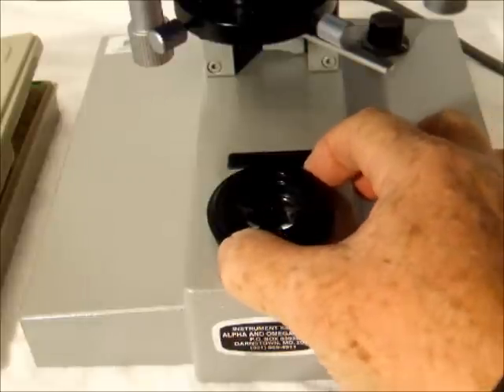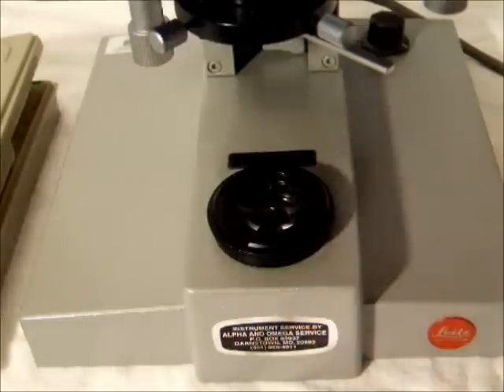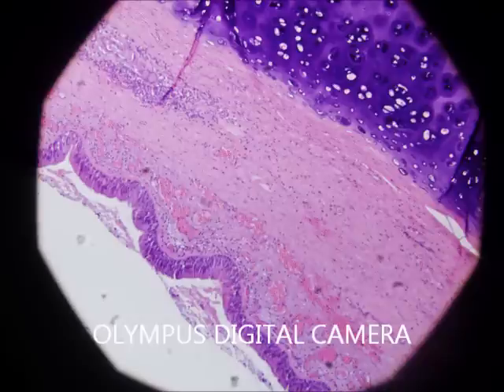Step 8. Open up the light diaphragm until the light just covers the field of view. This illustrates what you should see just before the light has filled the entire field.